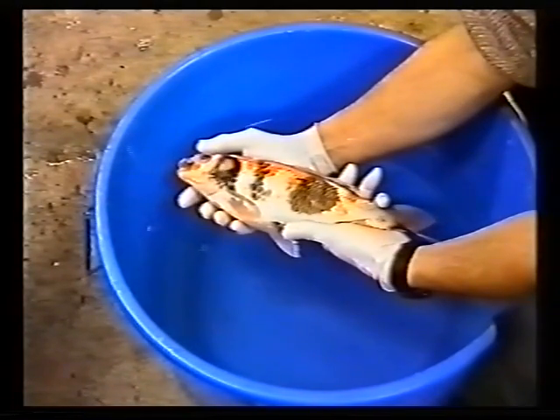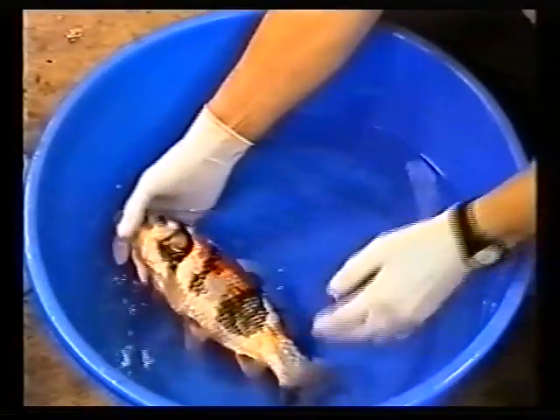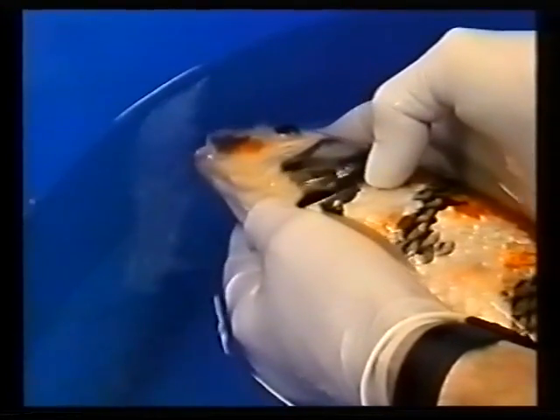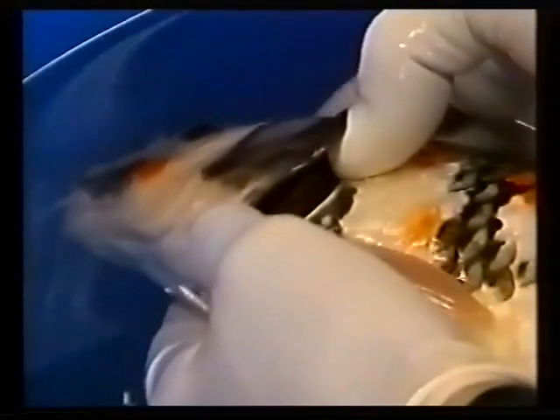For the expert, it is rarely a problem, but for the novice, possibly the safest way is to slightly sedate the fish to calm it down. The scrape can then be safely carried out. With the fish under sedation, a quick inspection of the gills would be appropriate, as it is good practice to inspect the gill condition whilst you have the opportunity. Maybe the problem is a gill condition, causing the fish to show signs of irritation in the first place, prompting you to take the scrape.